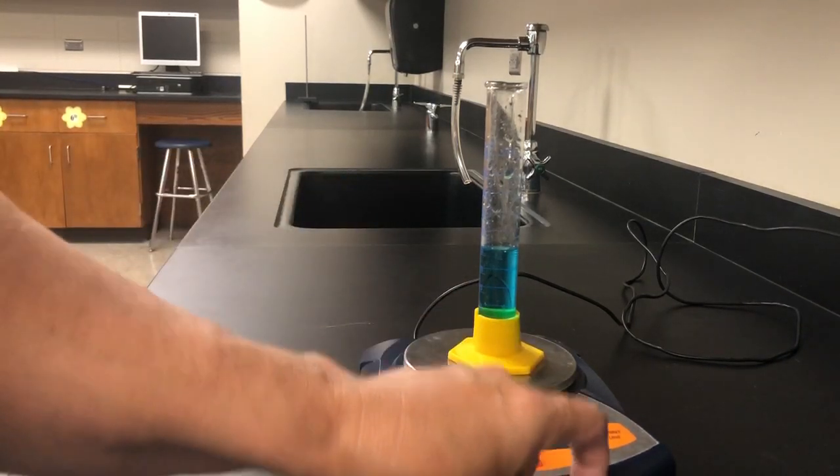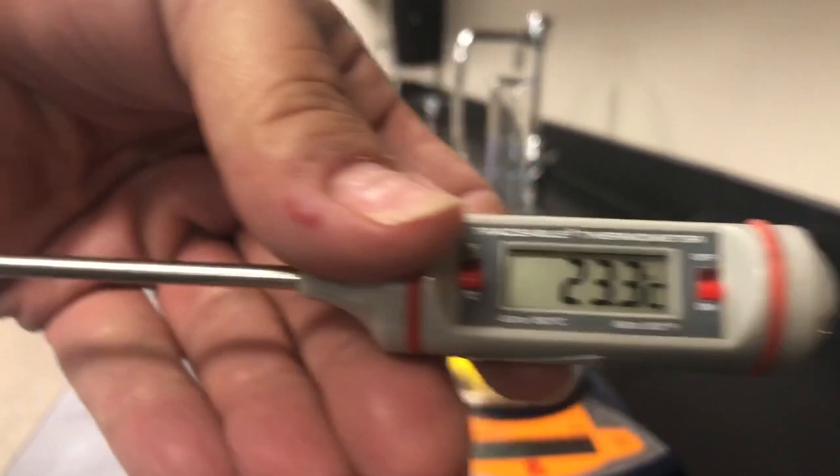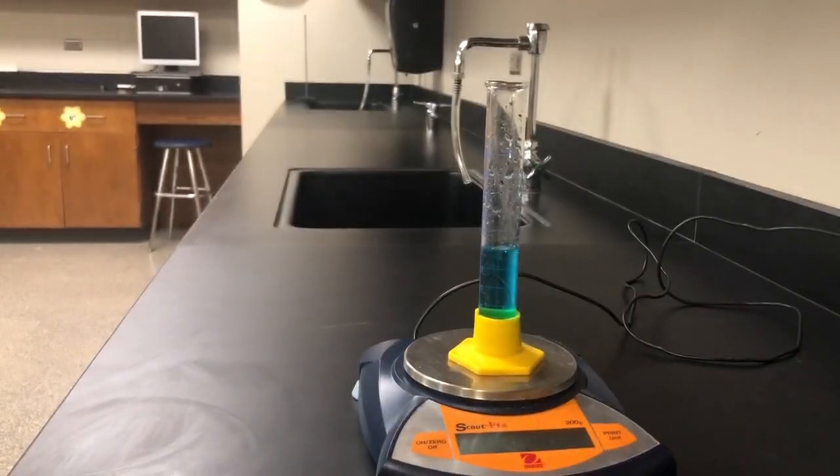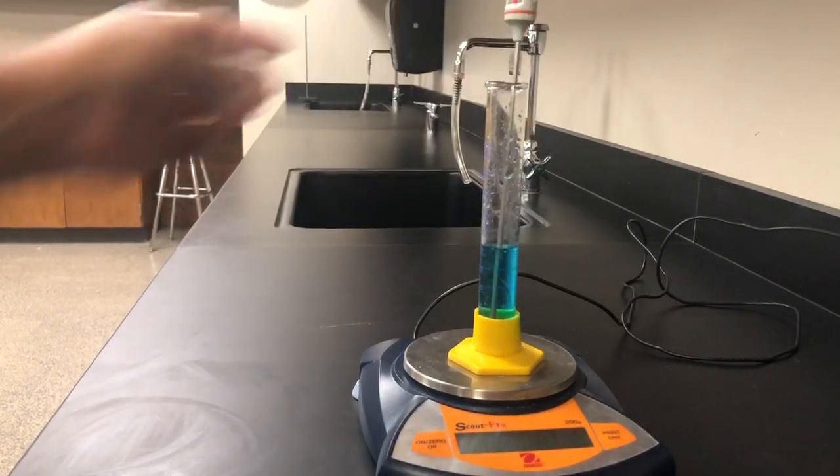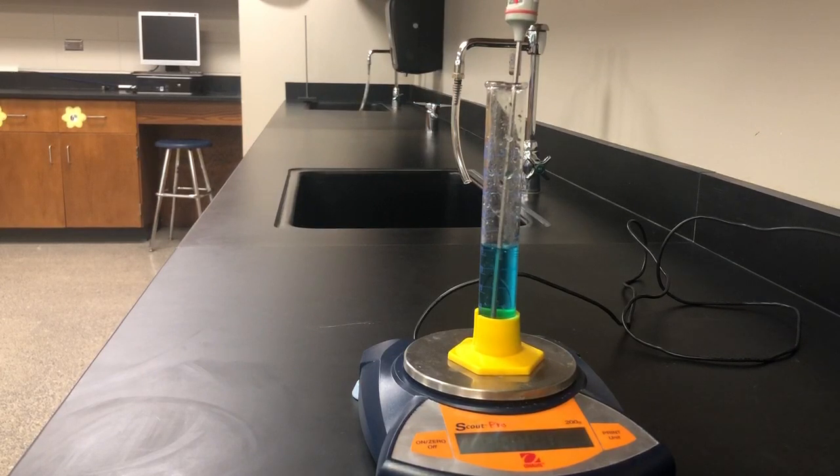Finally, I'm going to take this thermometer and put it into the solution. We don't expect it to change that much because the solution is sitting at room temperature. Let it stabilize.